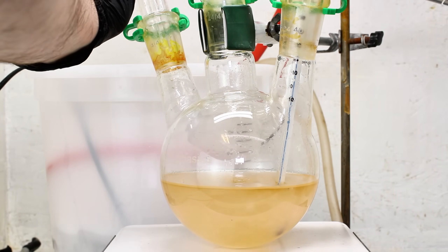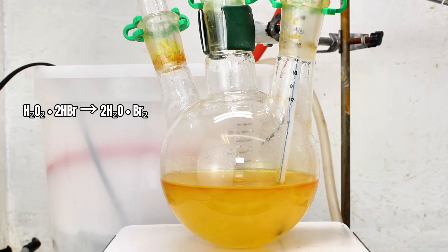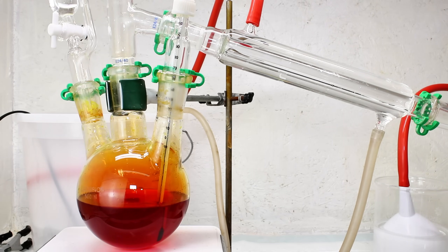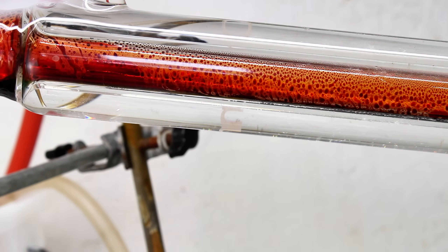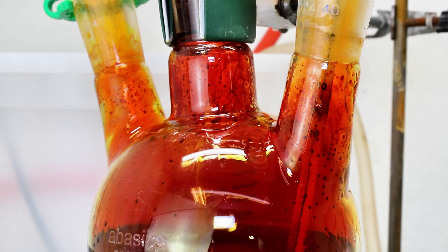What's happening now is a fairly basic single replacement reaction between one molecule of hydrogen peroxide and two molecules of hydrobromic acid. Essentially, the second oxygen of hydrogen peroxide has more affinity for hydrogen than it does for the water molecule it's already bound to. Since hydrobromic acid is an extremely strong acid, its hydrogen doesn't have much affinity for the bromide, and will readily leave to bond to the oxygen provided by the peroxide. The hydrogens previously bound to the bromides take their electrons with them, leaving the bromines in an uncharged state, making this technically a redox reaction wherein peroxide oxidizes hydrobromic acid. Uncharged bromine is a halogen and is thus one electron shy of filling its octet. Under the conditions provided by this reaction, the easiest way to fix this is for two of the newly formed bromines to share one electron with each other, forming a covalent bond, and thus the reaction is complete.